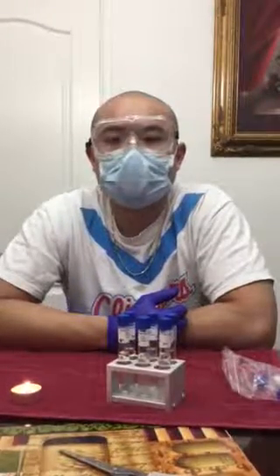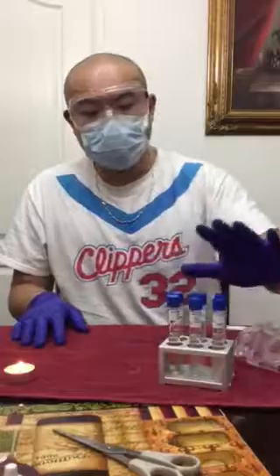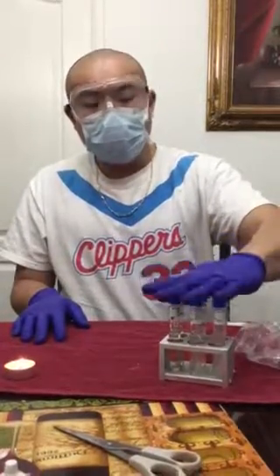Today's December 5, 2017. Today I'm going to be explaining the experiment of the environmental influences on microbial growth, the salt tolerance testing. So for the first part of the salt tolerance testing, I started by cleaning my work area and gathering all my supplies, which are the NaCl nutrient broths, which is right here.